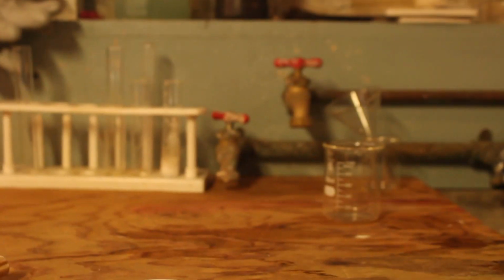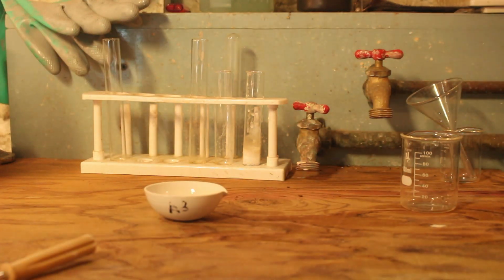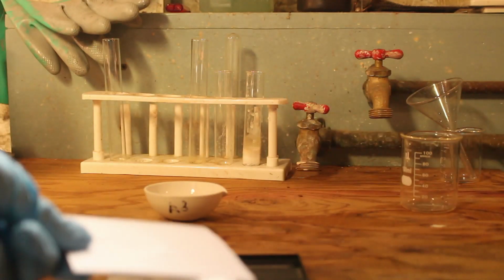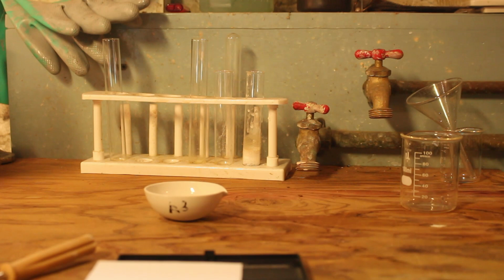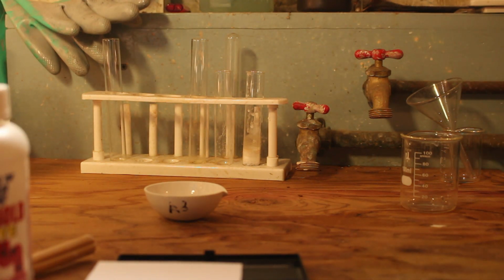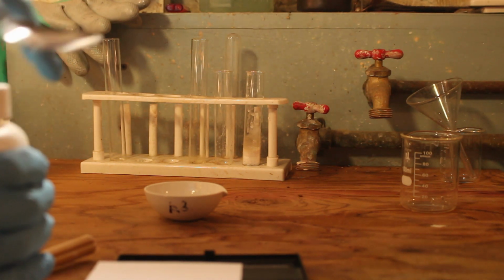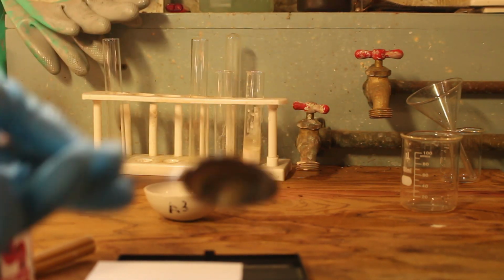Alright, we're done mixing that into a rather granular mixture. I'm not going to say that was perfect, and sorry for knocking the camera there. So we now need a little bit of sodium hydroxide, so let's get the scale out again. And this time we're just going to use paper because we really don't need that much. We need, I believe, about 1.11 grams, so not that much. So we get our definitely proper sodium hydroxide in our glorious chemistry spoon. Remember kids, don't mix them up.